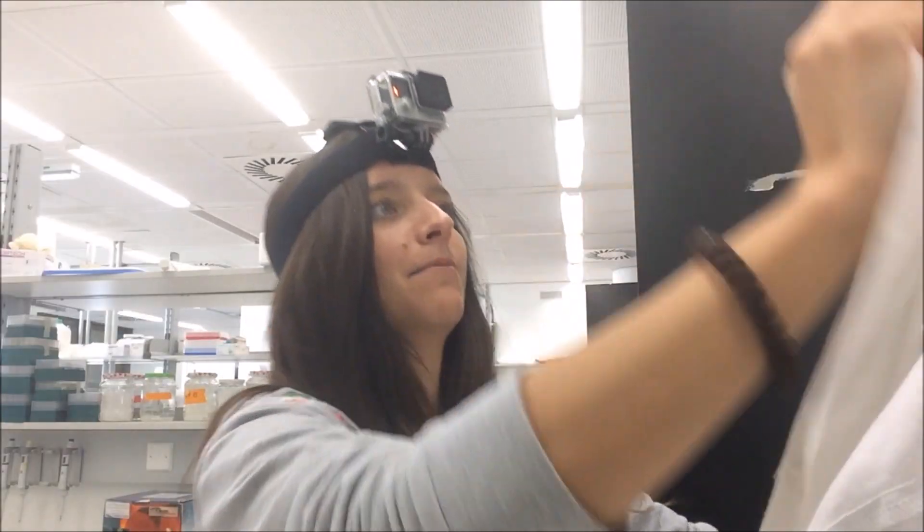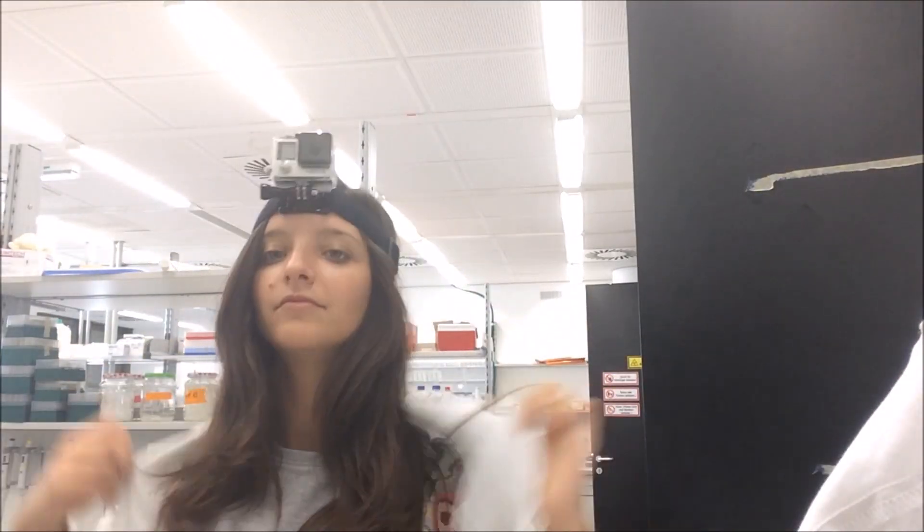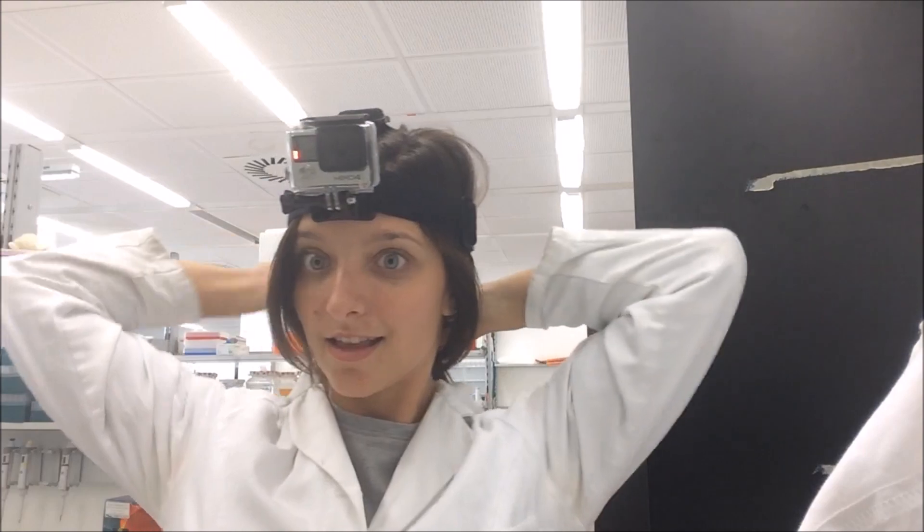Hello, welcome to day six of Maria's daily vlog. I am at the lab, I have my GoPro on which I am now turning on. There it is — you can now see what I'm gonna do in the lab. People are gonna think I'm crazy in the lab, but it's fine, they don't know that already. Let's go.